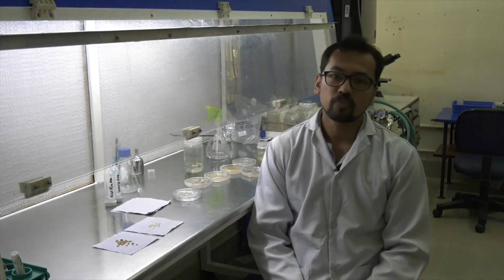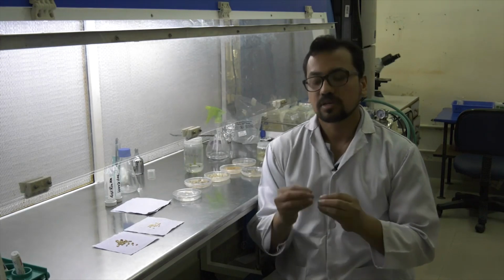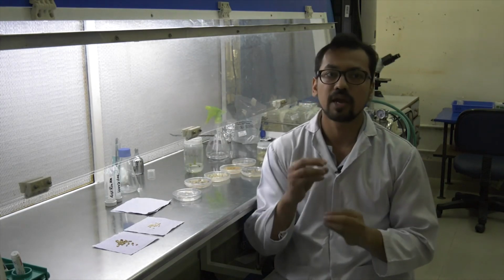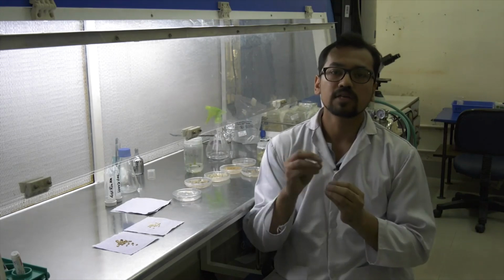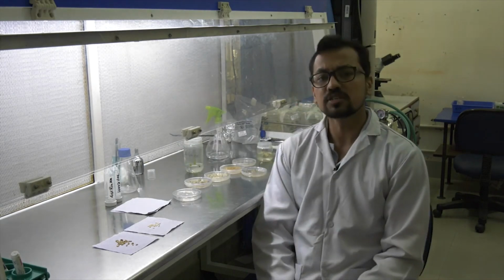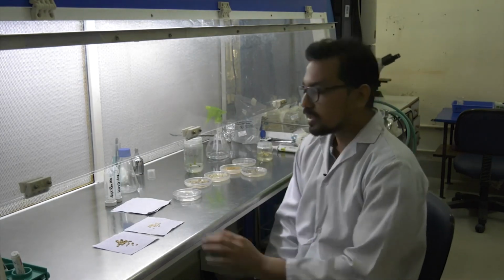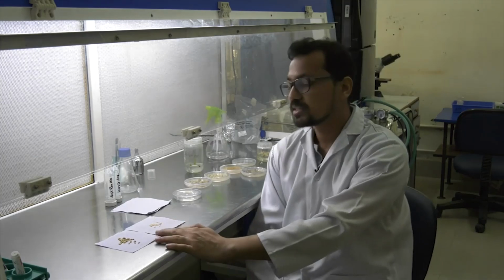The second one is where a gene gun like instrument is used for the transformation, where gold particles are used and the gene that we have to transform is coated on the gold particle, and then this machine sends this gold particle along with the gene into the cells, and the cells which are transformed regenerate and make the new plant. So first we will be going through the biological method of transformation, where in our lab we use rice as an explant.